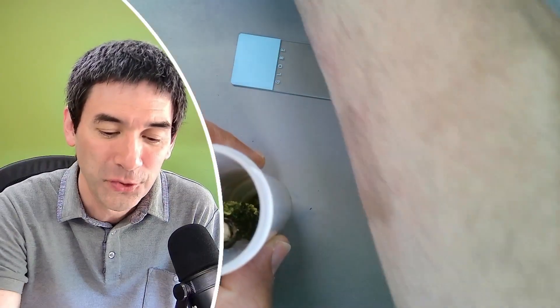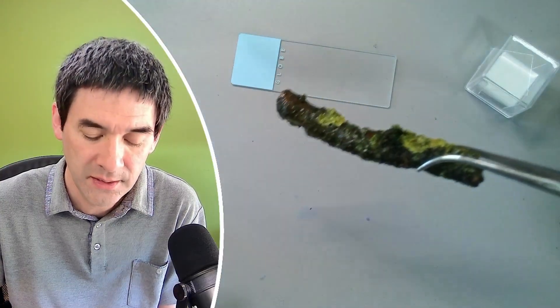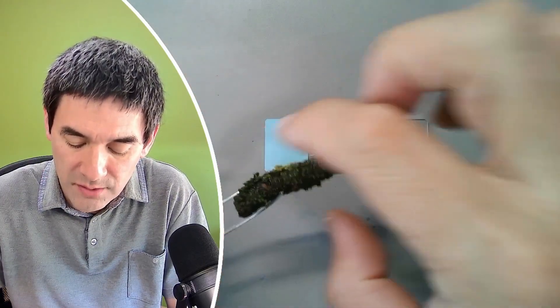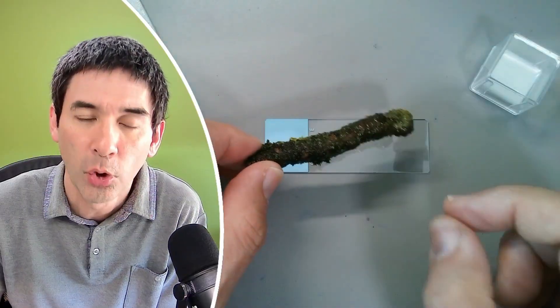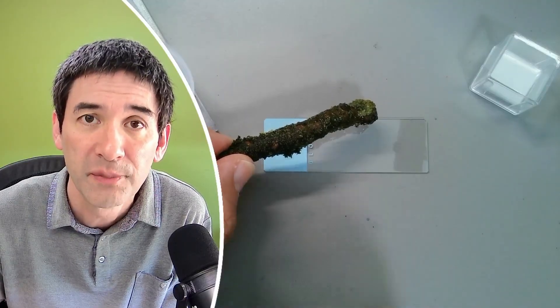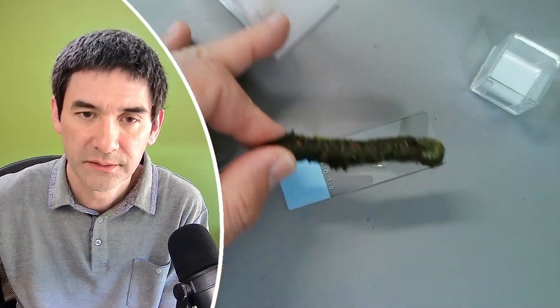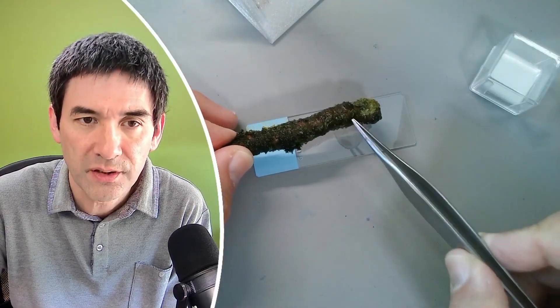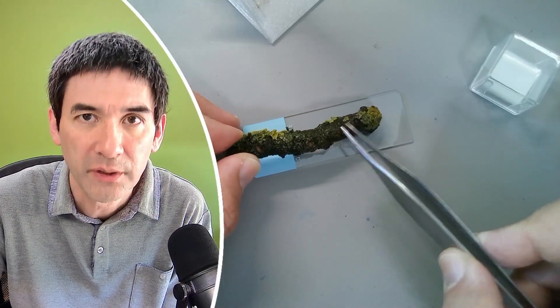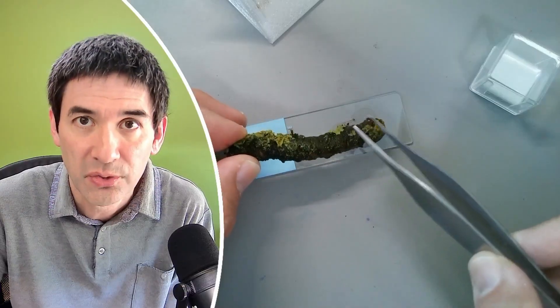So I have to get it out first. Now, how are we going to continue? My recommendation is the following: I've made myself a little stand here. You take some object and you scratch off carefully a little bit from the surface, and you basically collect whatever you've got here on the microscope slide. Put down a small drop of water first, and then carefully take off a little bit of the sample. Make sure that there is enough solid material present, but later on we're going to remove some of the solid material again, because otherwise the cover glass is not able to lie completely flat.